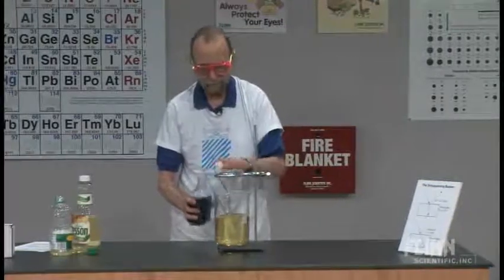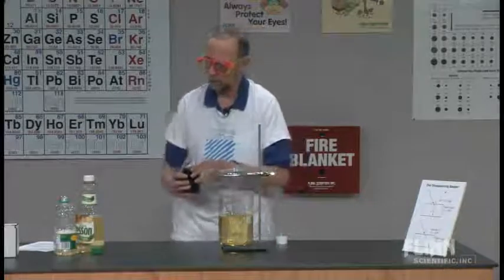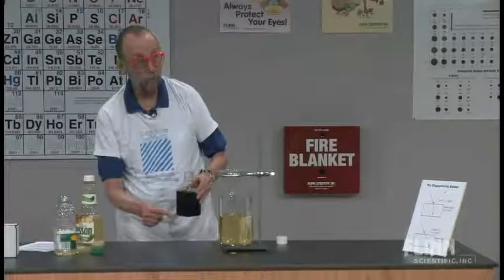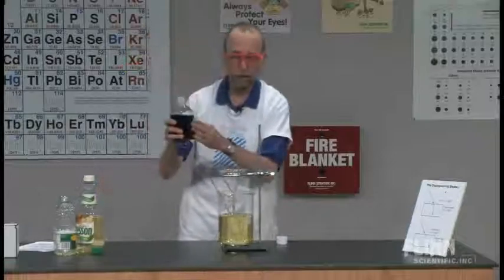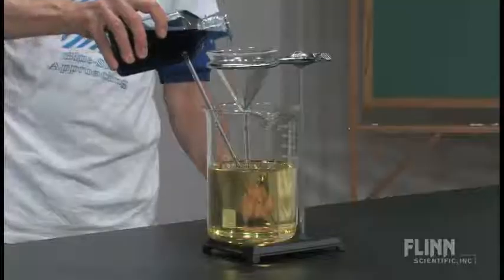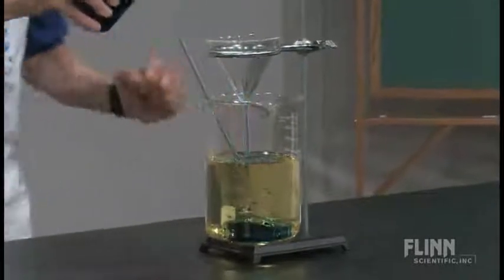Now, I'm going to pour this in. Okay, so Dave, let's see if I wrote the script. Dave, we have a magic liquid here. See, it contains only a yellow liquid. I want you to pour this blue liquid into this funnel, and watch what happens. By the way, I can't tell what I'm doing here.